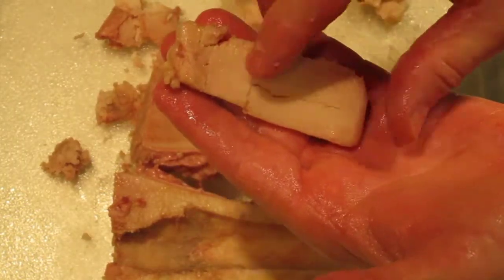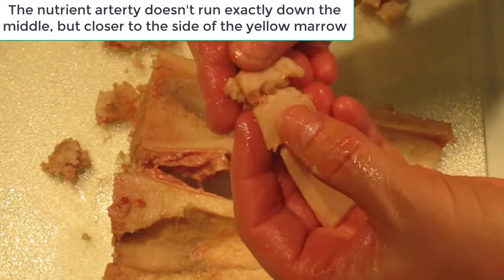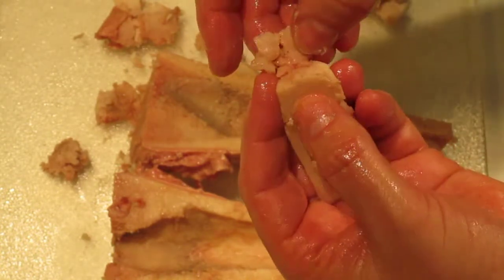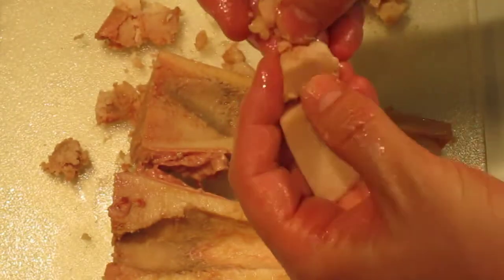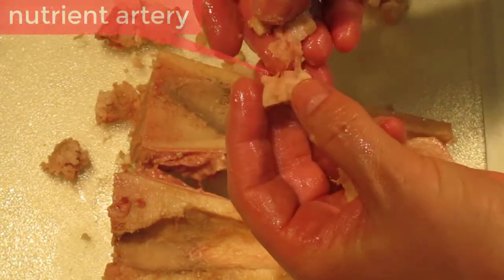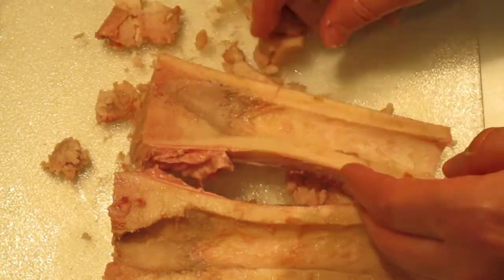Here's the yellow marrow — I pulled it apart a little bit so you could see. The nutrient artery runs to the middle of the yellow marrow, which is very interesting. You can see it if I pull it apart — there is the nutrient artery running right there. I've actually pulled it apart so that's the center of it. The nutrient artery is in the middle of your yellow marrow, so it's protected by the yellow marrow.